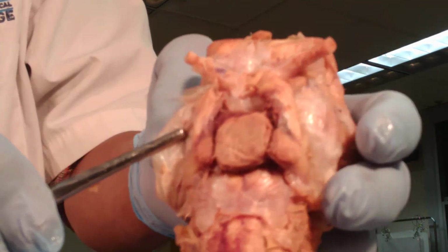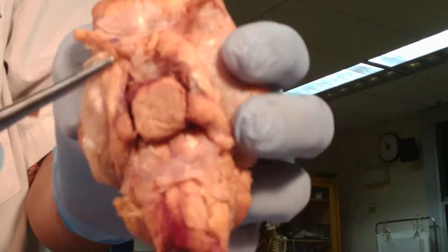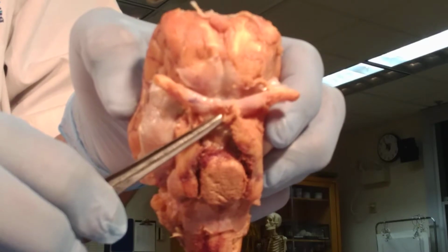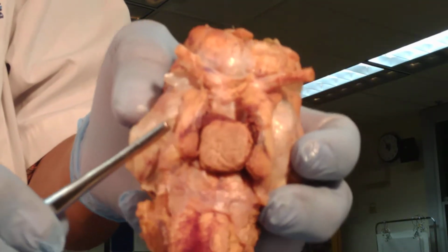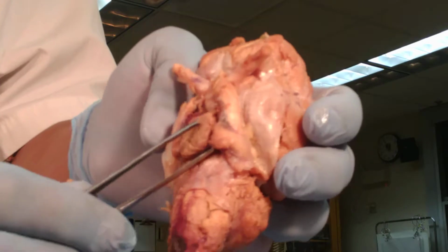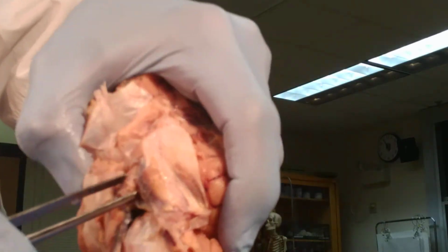And this is the dura mater. These are the two optic nerves, right and left. In the middle, you are going to find the optic chiasma, and that's where the two optic nerves intersect. Good news, the dura mater is not removing this part, so that will enable us to take a look at the pituitary gland, which is here, and you also see it here on this brain.